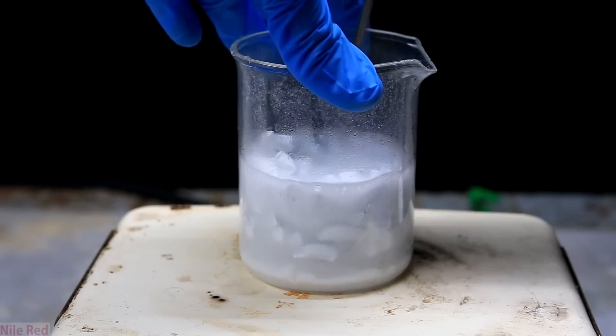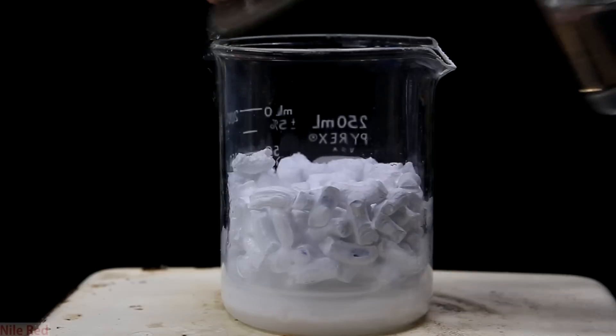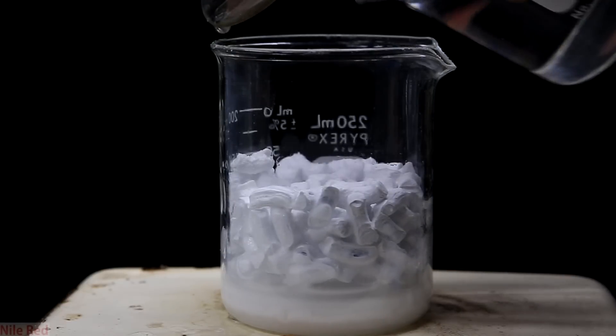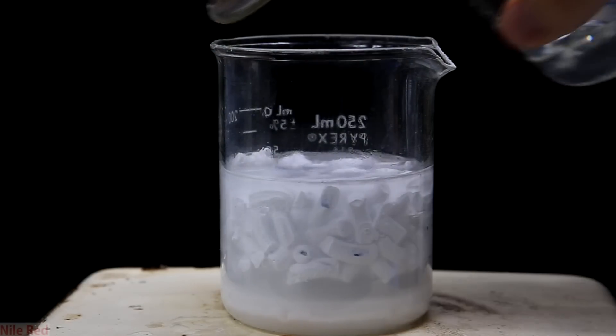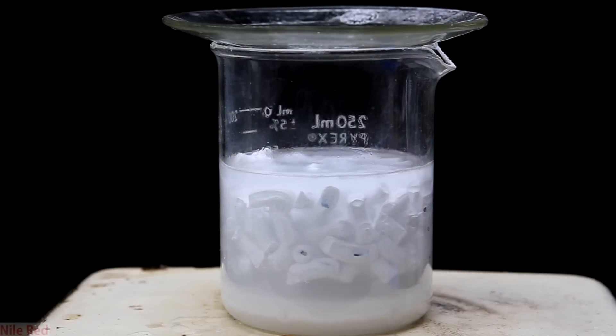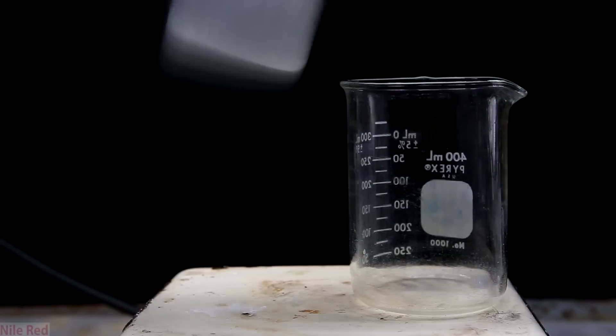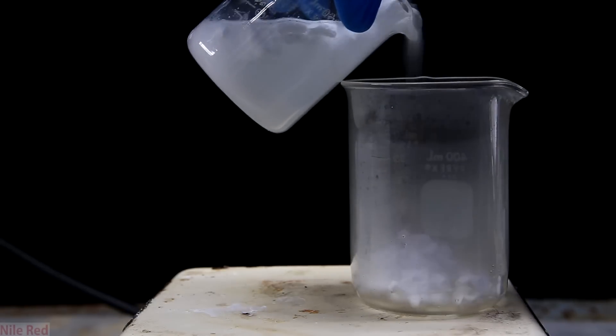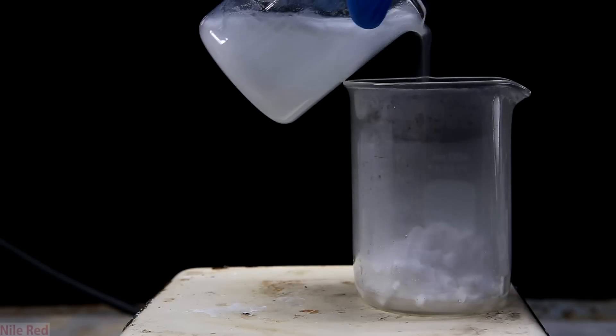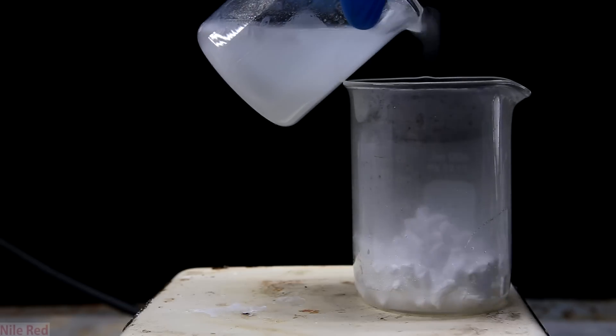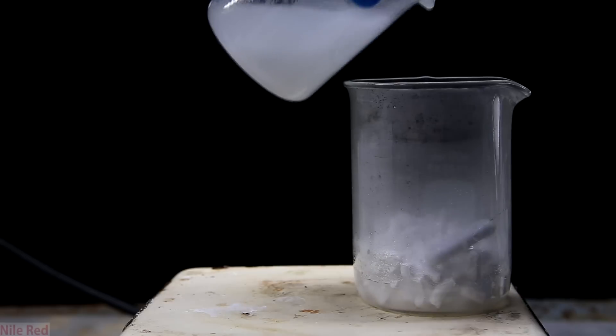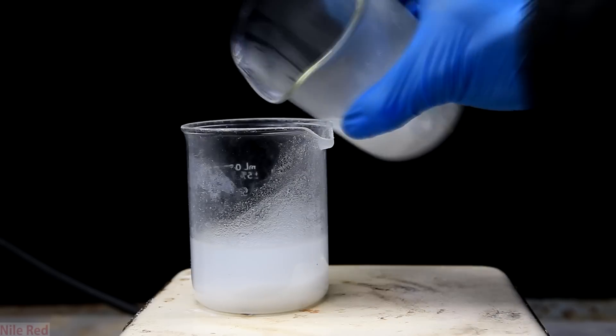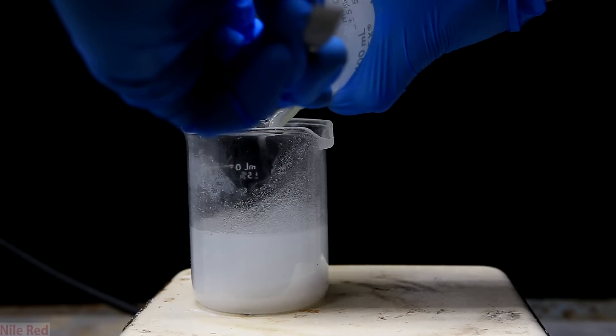It also solidified a little so I poked it a bit with a spatula. Eventually a lot of the water had disappeared and the reaction rate was super slow, so I added a bit more water. Sadly though this didn't do much because the coating of lithium hydroxide was just too thick. I realized at this point that it's really impossible to get away with using such a little water, so I transferred it to a larger beaker. I made sure to separate the saturated lithium hydroxide solution from the pellets and to keep the solid at the bottom. This way when more water is added it'll be all fresh water instead of just diluting some saturated solution.